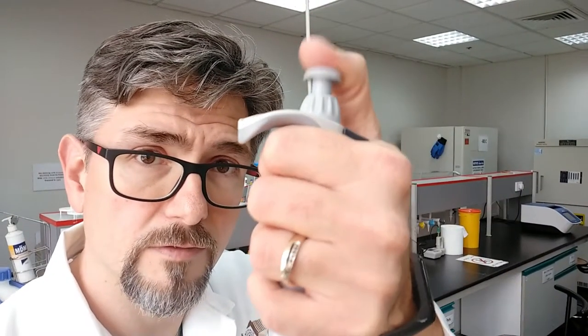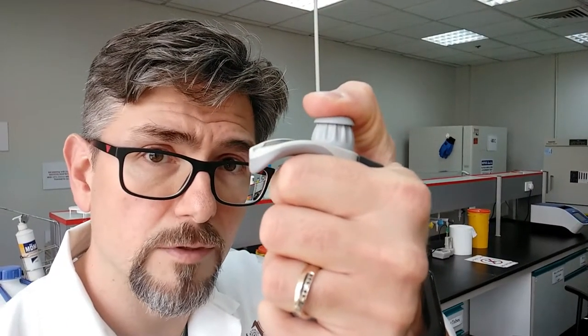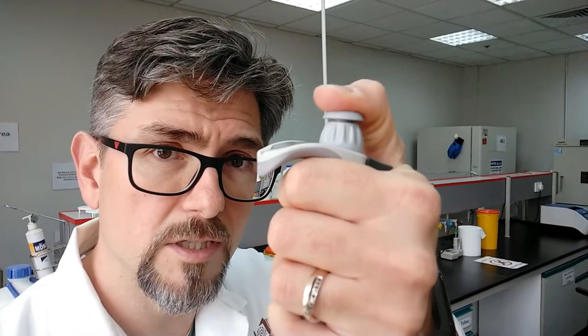Hi, in this video we're going to show you what happens when you have bad micropipetting technique. For example, first stop, second stop. Is there really that much of a difference?